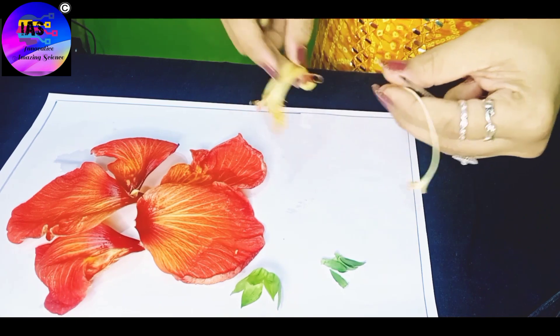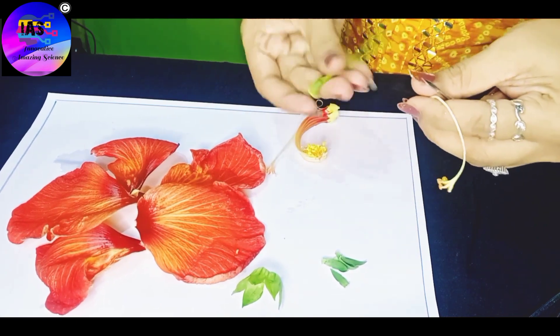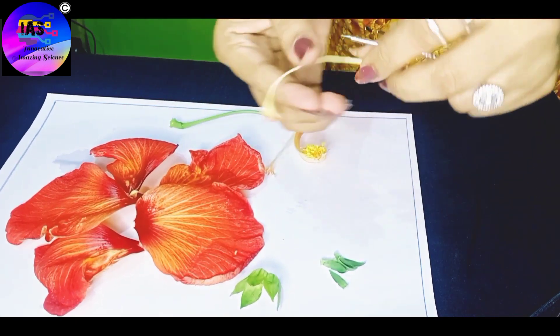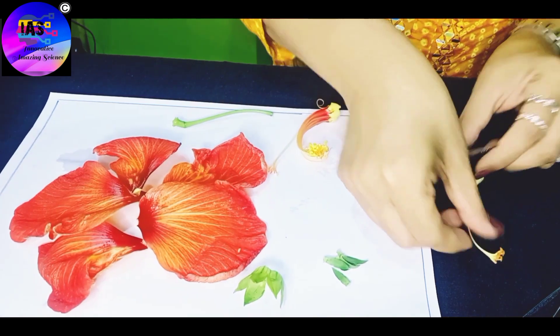Now you can see that I've separated the entire pistil, and it contains three parts: the stigma, the style, and the ovary.